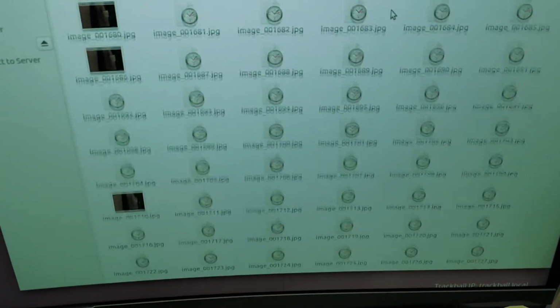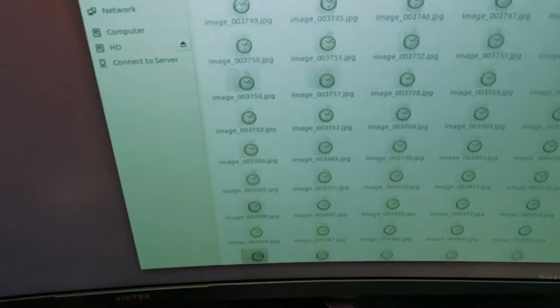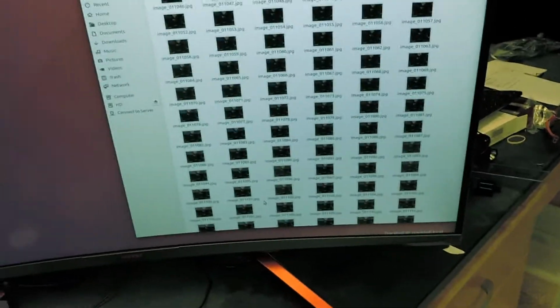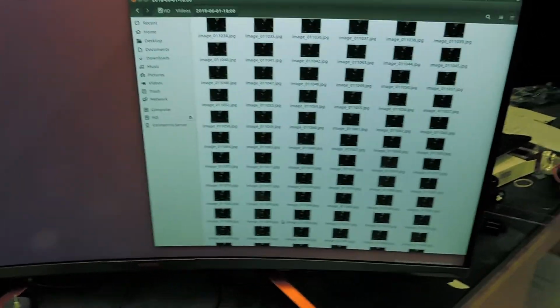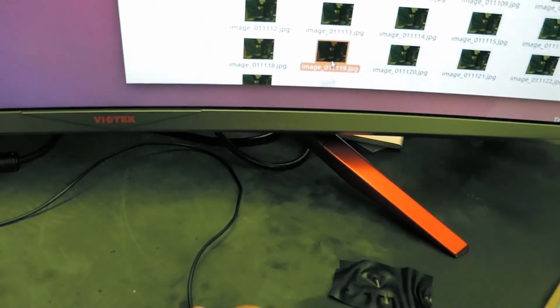Unfortunately, I'm not capturing the metadata of the timestamps of the frames themselves when they're displayed. Or rather, we're not capturing the time of the frames display directly. Instead, I'm imposing a timestamp on the image and then using the Tesseract wrapper in Python to extract that timestamp from each picture individually, which takes some time.